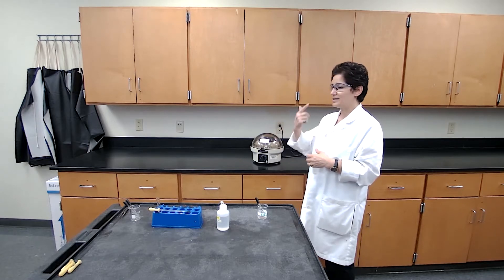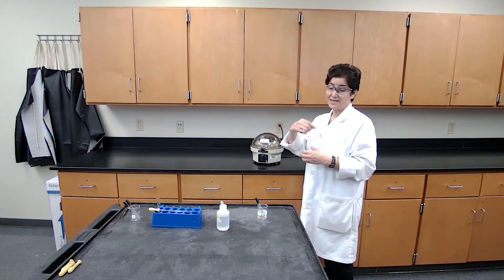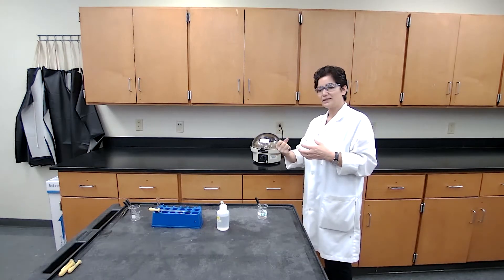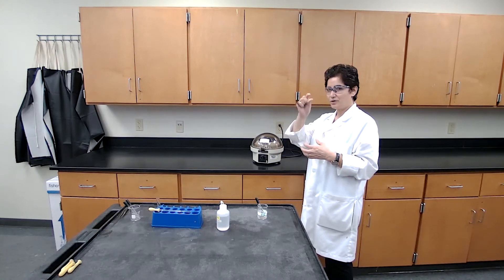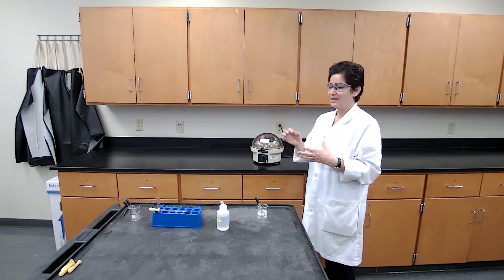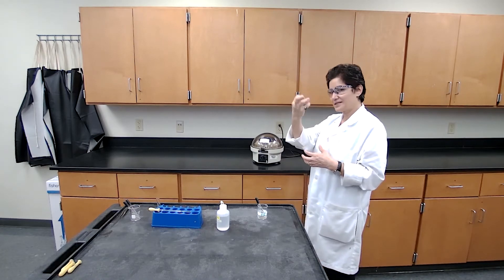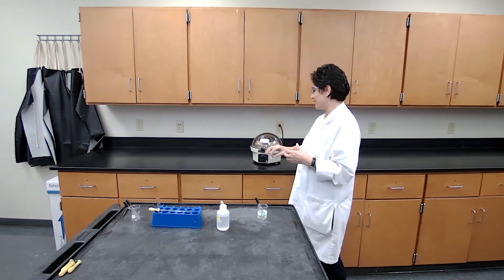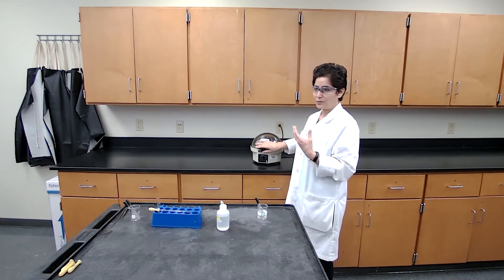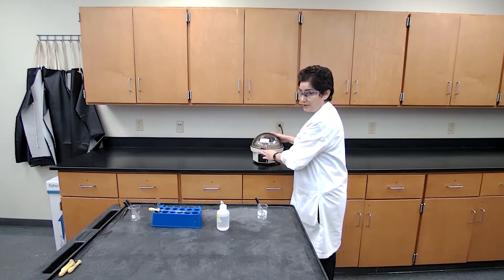What the centrifuge does is spin the test tube that contains a mixture of solid and liquid so the solid settles down completely and the liquid portion gets separated. When we take it out, I expect to get a clear solution on top and the solid settled at the bottom, which we can decant by pouring off the liquid portion.